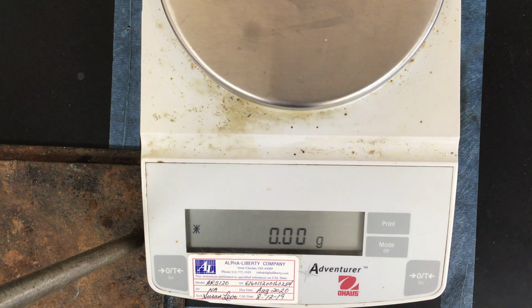What I'm going to be doing is showing you a vial, and each vial has a different chemical sample in it, and then I'm going to put it on the balance so that you can see the mass of that vial. Ultimately, what you need to do is record the formula of the chemical that's in each sample, match that up with the appropriate name on your data table, record some observations about the physical appearance of each chemical, and record the mass of the vial.